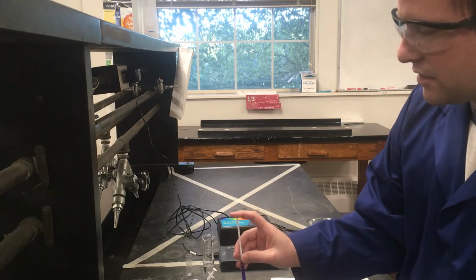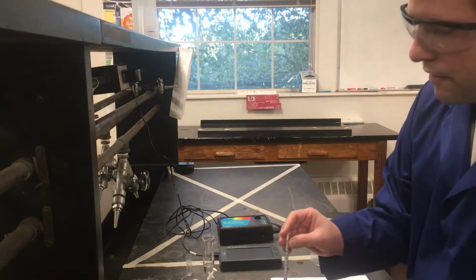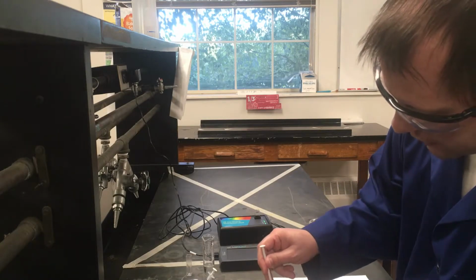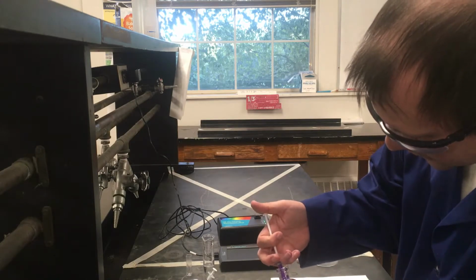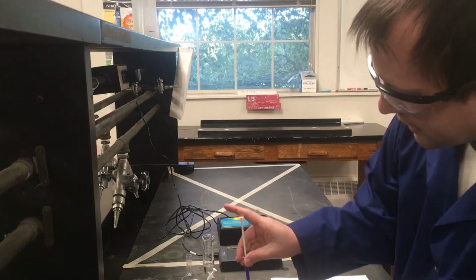And I can add this to this beaker that I'm going to create my solution in. I'm going to do this 5 times to get my 5 milliliters. I'm going to do this real quick so that I have all of the crystal violet that I need, and then I will go back and add water to this. Just trying to make sure I get reasonably consistent, accurate measurements. So this will be my 2nd milliliter.